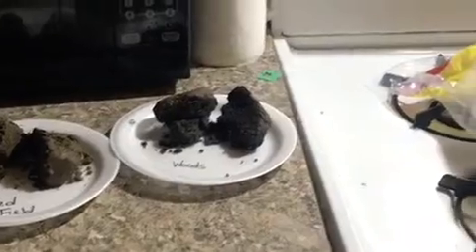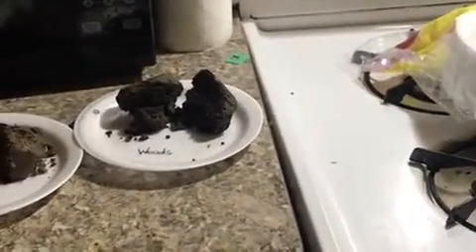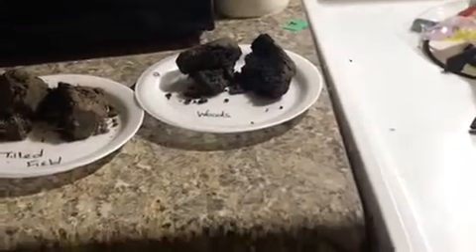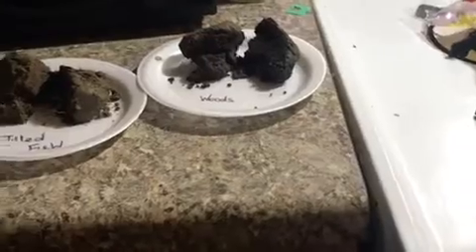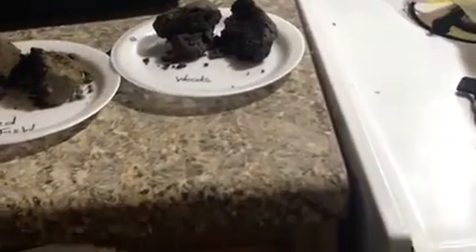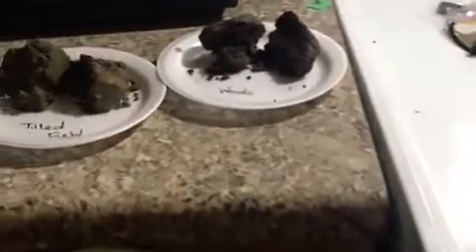Alright, in this video, I will be doing soil aggregate testing using two different methods to find out about the particles within the soil samples.